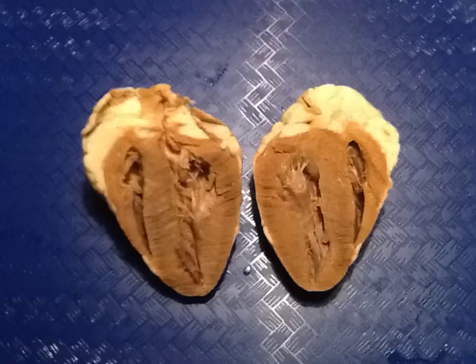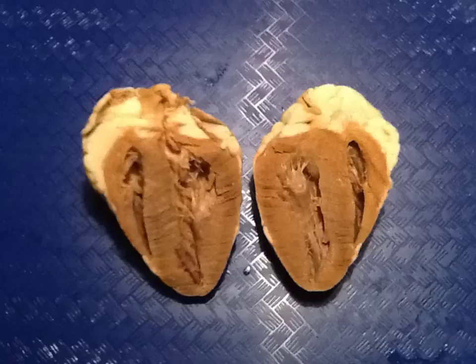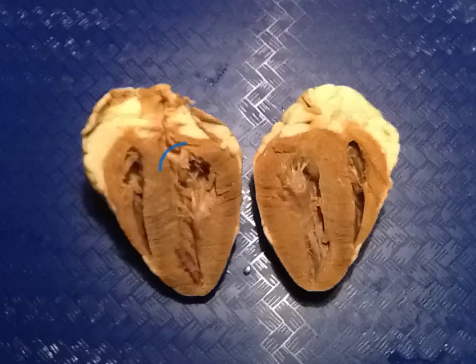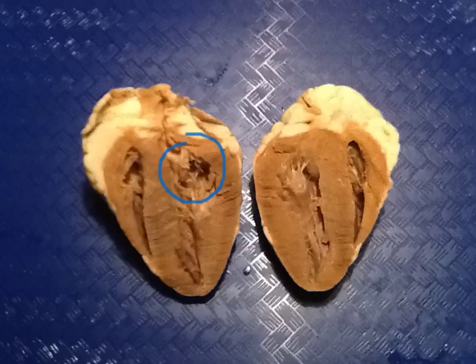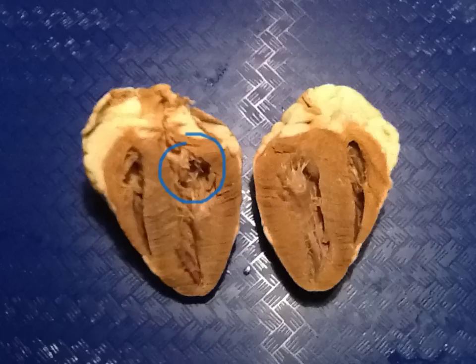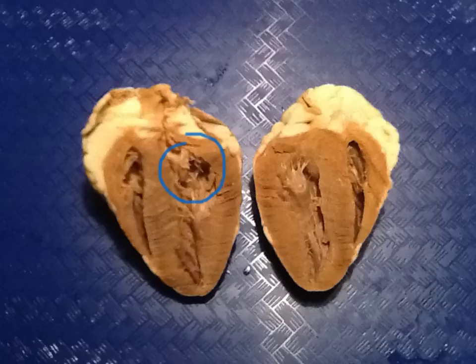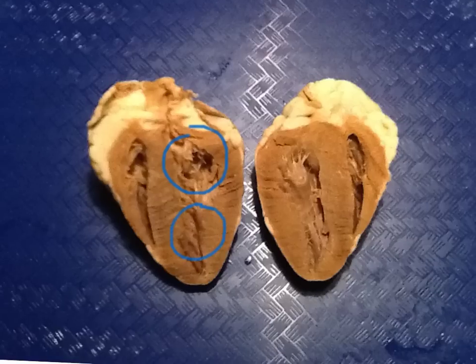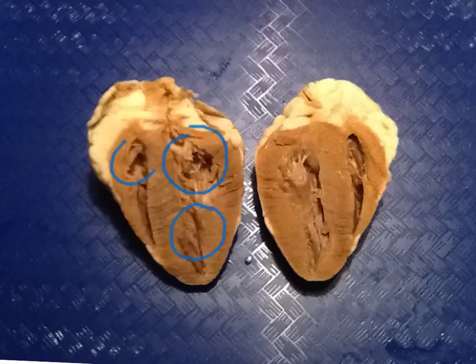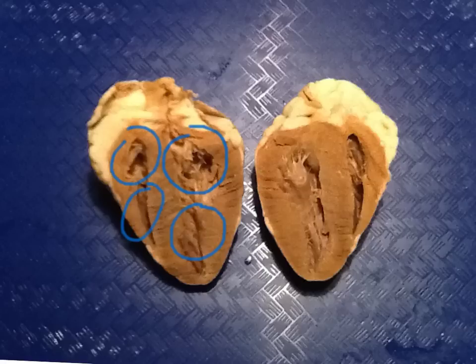Next, let's examine the four main chambers of the heart. Here you will see the left atrium, the left ventricle, the right atrium, and the right ventricle. Those are the four chambers of the heart.